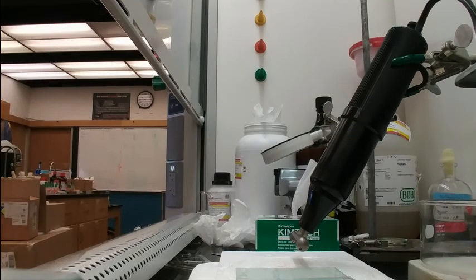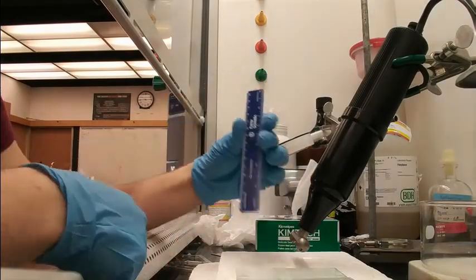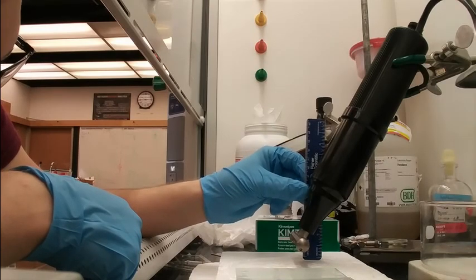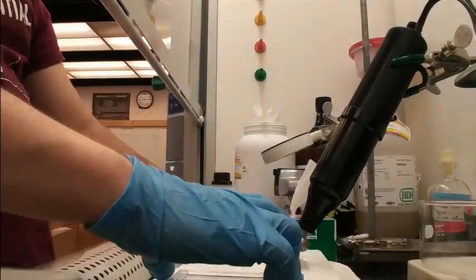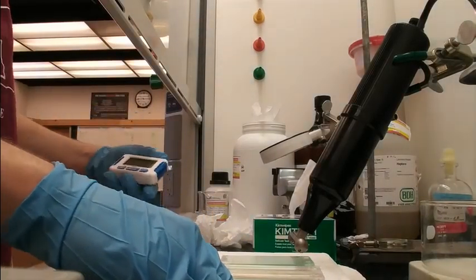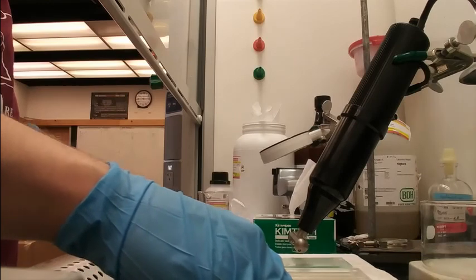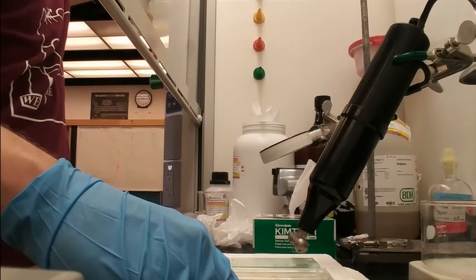Next, we will ensure the corona discharge machine is aligned and plugged into the socket. We make sure it's two centimeters above the surface of the chip on top of the styrofoam plate. The styrofoam plate allows us to move it backwards and forwards in the machine without getting shocked. We will use the corona discharge for 1 minute and 30 seconds on the FTO and for 1 minute and 30 seconds on the PDMS, repeatedly moving it backwards and forwards along the length of each surface. If you can see arcing, you are probably too close to the head of the corona discharge.